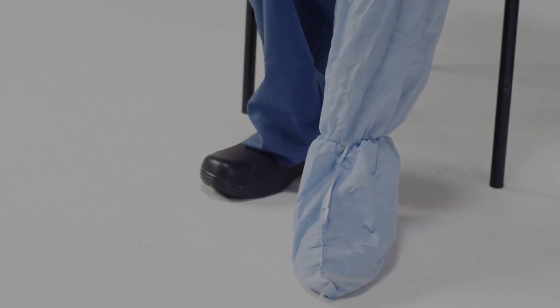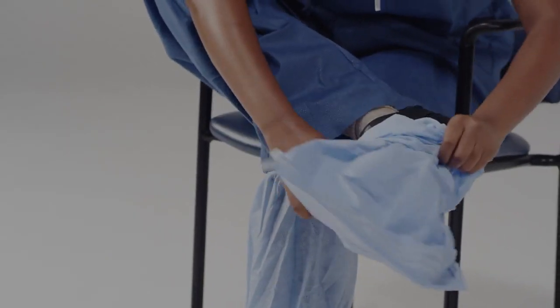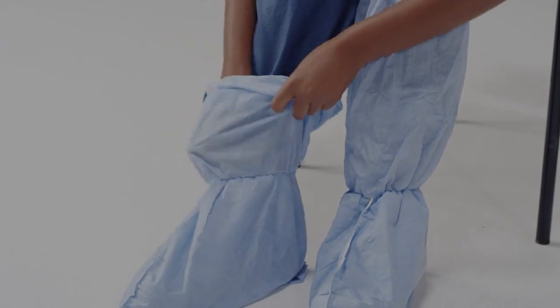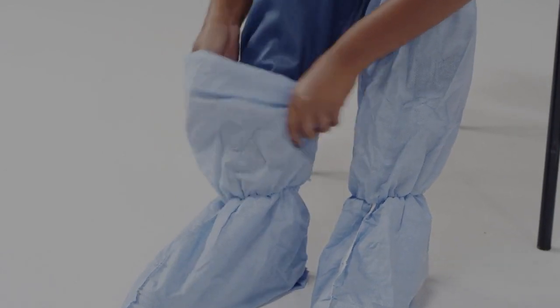If your boot covers have a strap, wrap the strap around for a comfortable fit. Try not to touch the floor or other areas with your hands while putting the boot covers on. If you do, disinfect your hands before putting your inner gloves on.